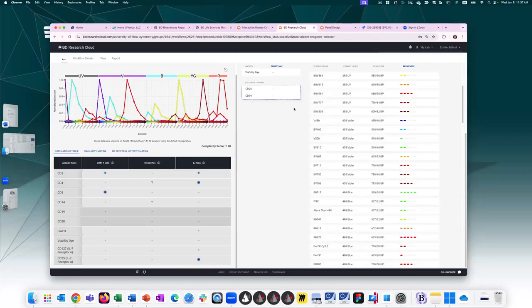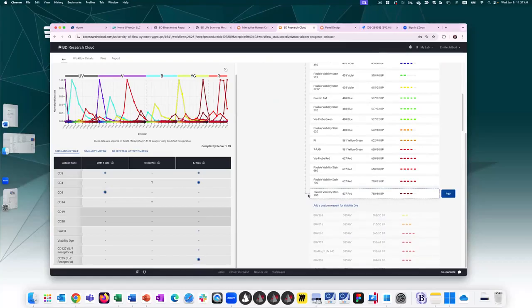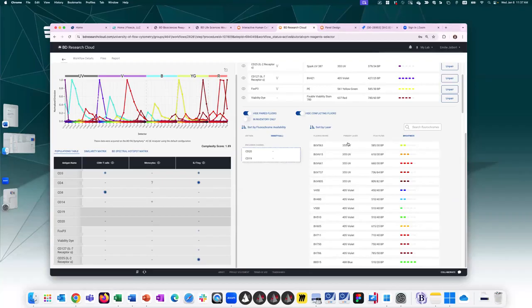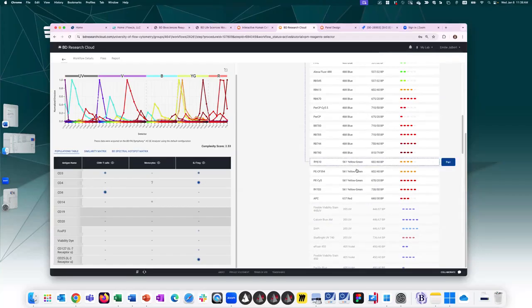And the last two, the exclusion channel and the viability dye, have much more flexibility because you are gating out cells. So they have a bit more leeway. For viability dye, I tend to like the far red. Let's go ahead and do that. And then CD20 and CD19, are there any gaps that I can fit something in? Maybe yellow, green, something in here, perhaps. APC is not too bad. So I won't spend too much time making a choice here, but I'll show you how to evaluate.